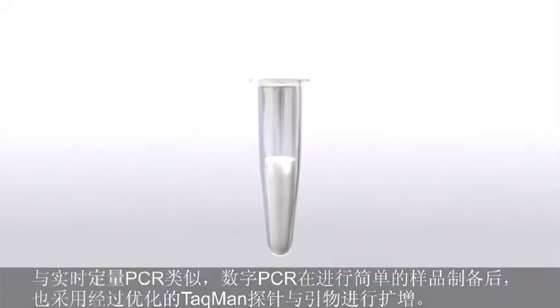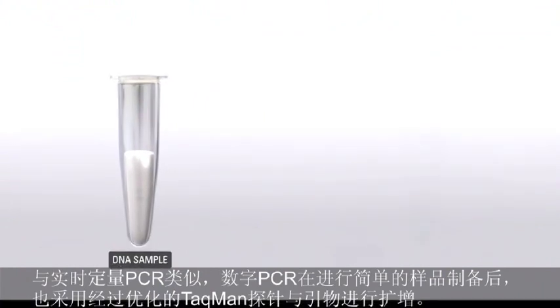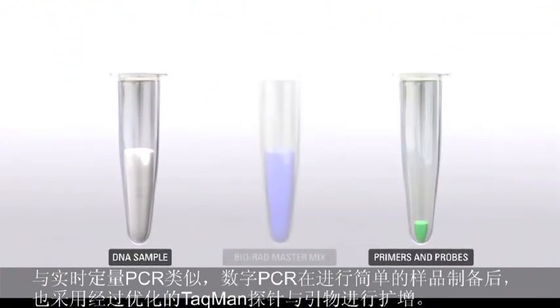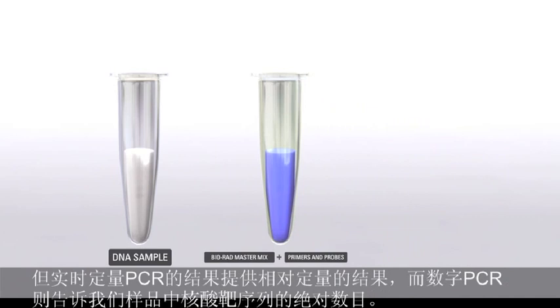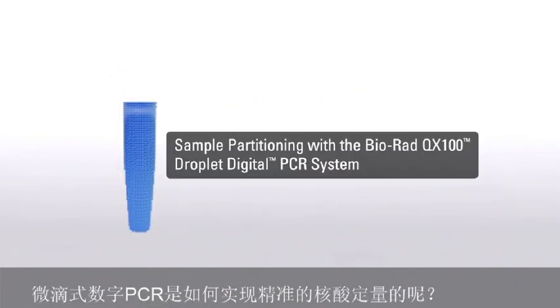Like real-time PCR, digital PCR uses a simple sample preparation that utilizes TaqMan primers and probes and an optimized supermix. Real-time PCR provides relative quantification. In contrast, digital PCR provides absolute quantification of target DNA sequences in the sample. Let's see how droplet digital PCR achieves precise DNA measurements.